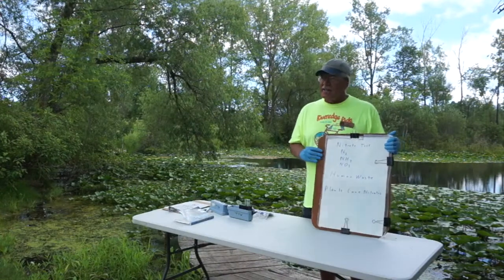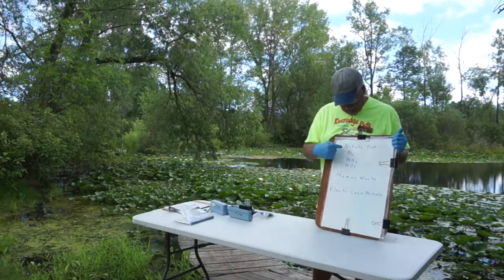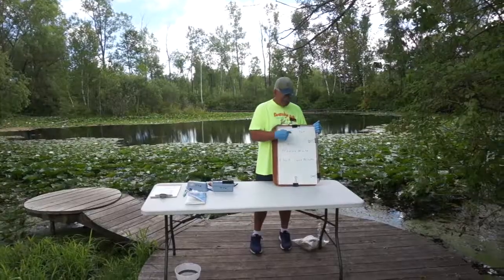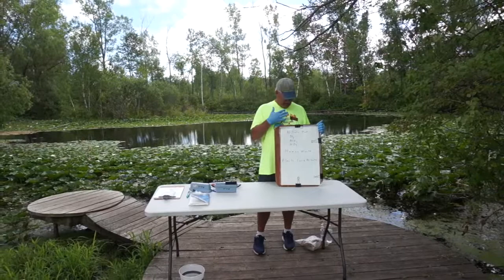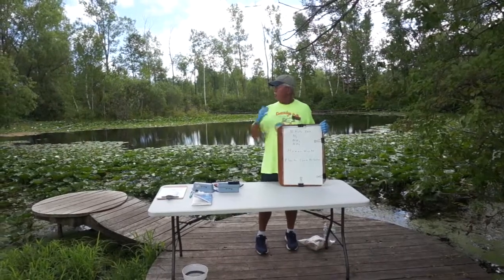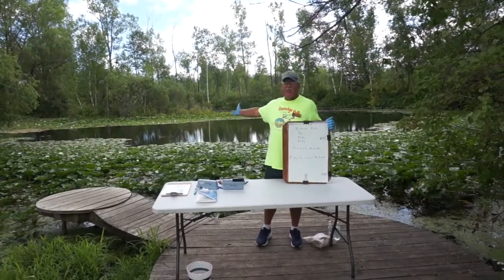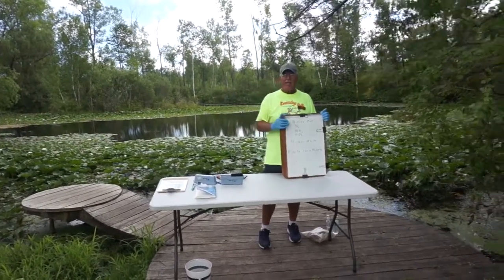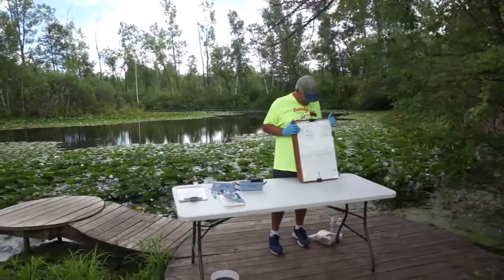Okay everybody, today what we're going to do is we're going to take you through what's called the nitrate test. My name is Stu Hannum. I'm a teacher naturalist at River Edge Nature Center. You can see we've got our pond behind us and that's the body of water that I'm going to be testing here.